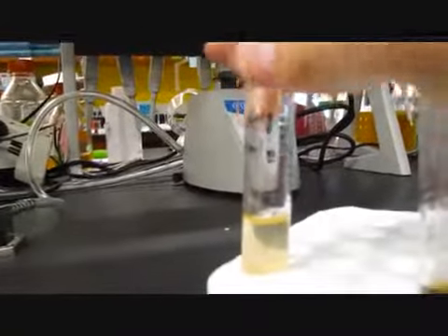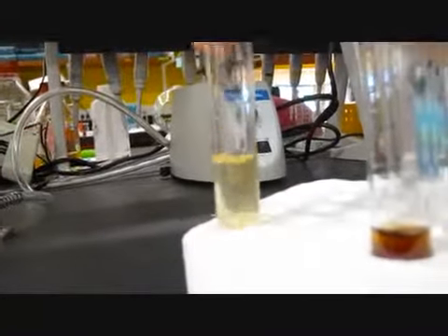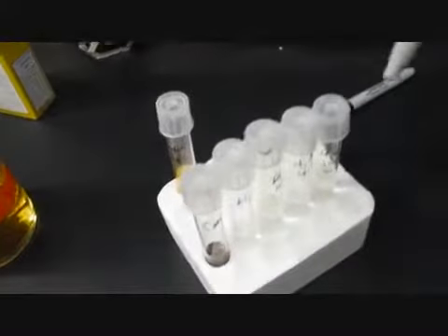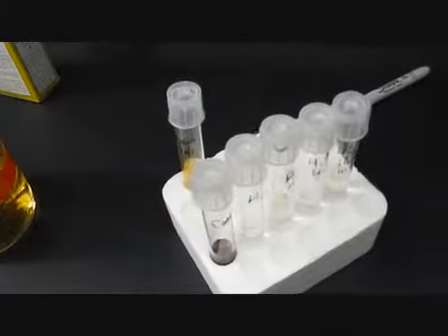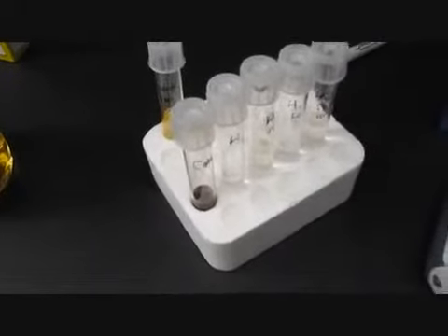As you can see, we have a little bit of bacteria here. It's only grown for about half an hour, but that's enough. We're going to pipette 400 microliters of this into each and every one of these samples, then let them culture overnight and plate them tomorrow.